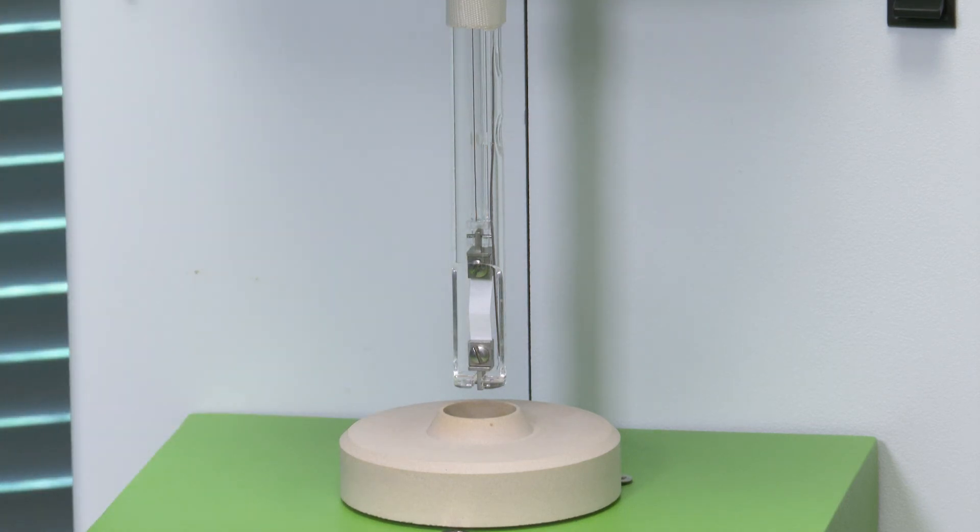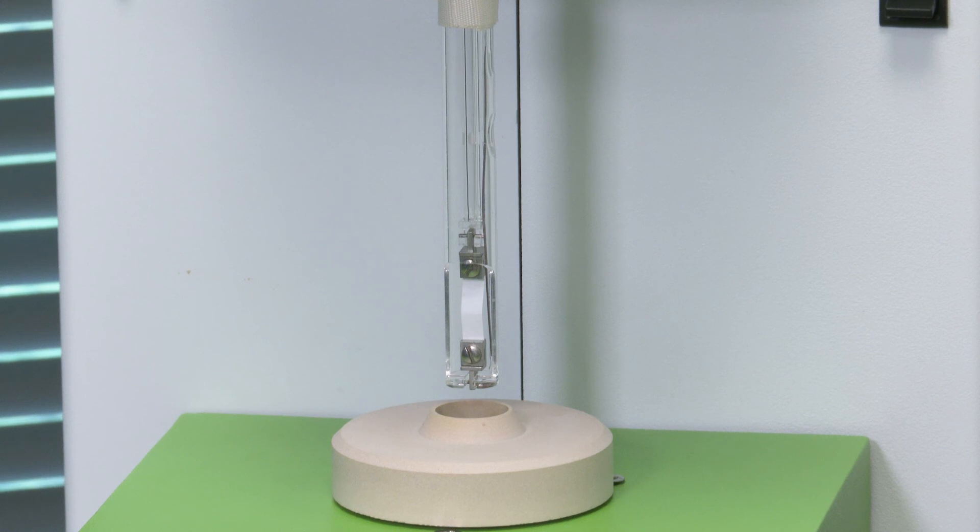Then you can set up the method and raise the furnace and run this sample.